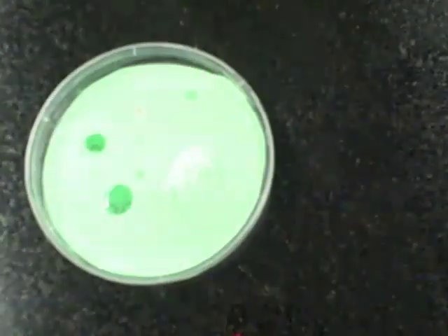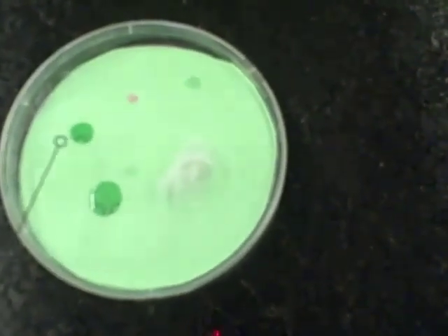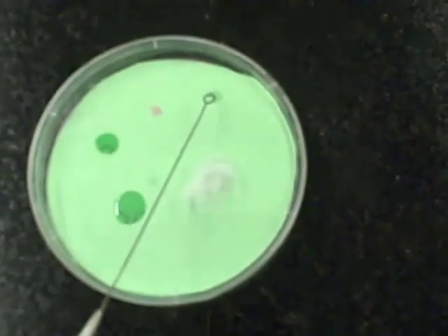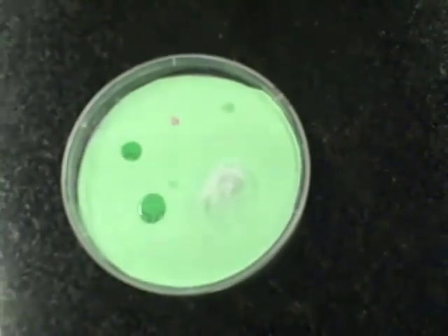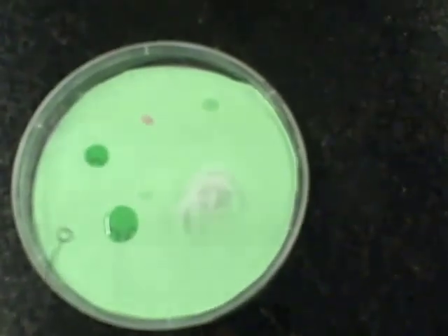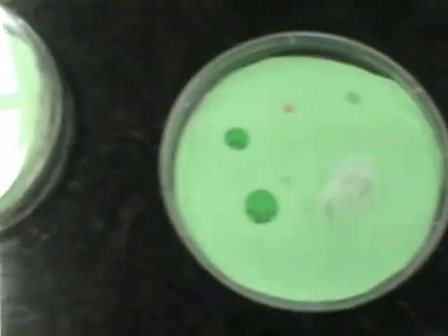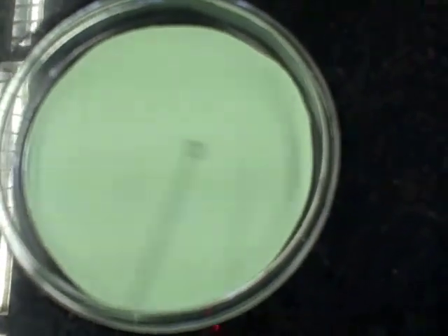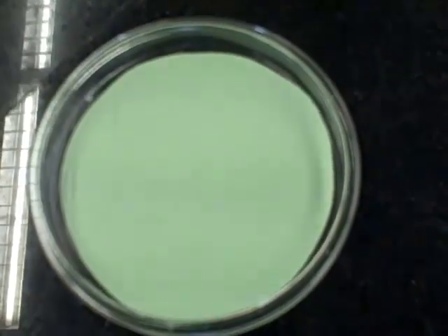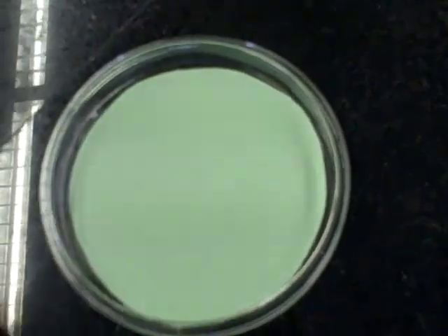As you can see here we've got a furry area that's a fungus, and we've got some smooth areas that are our bacteria colonies. We want one of our bacteria colonies. The purpose of today is to take one bacteria colony and to spread it onto a brand new agar plate, so the whole plate ends up covered with one type of bacteria — meaning we've controlled that variable for our subsequent investigation.